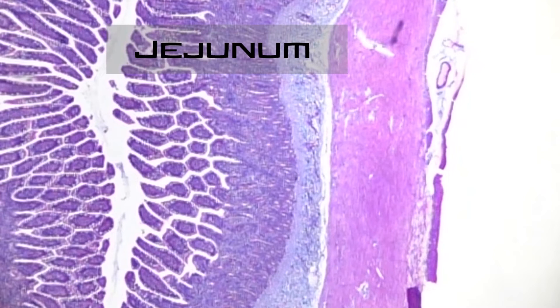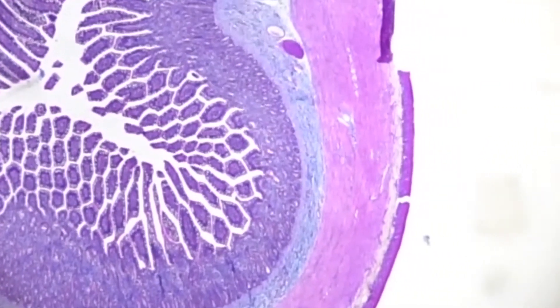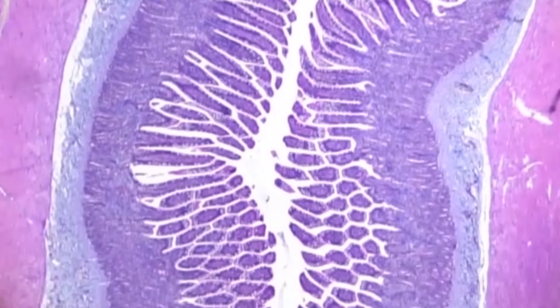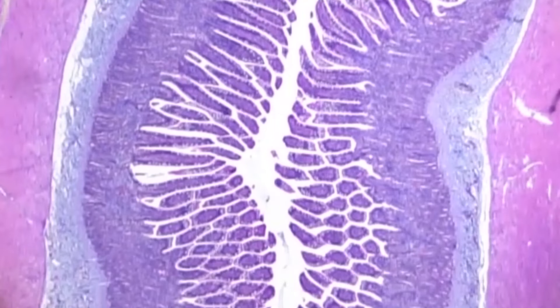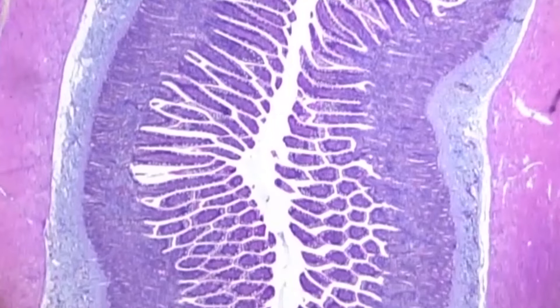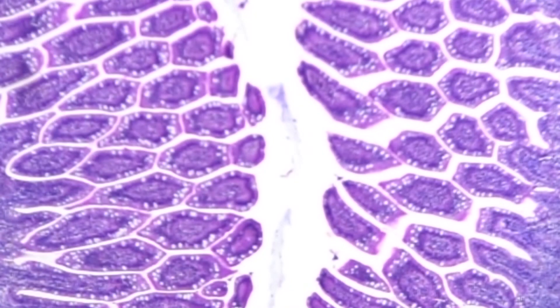The next slide is your jejunum, which is part of your small intestine. Your small intestine is a hollowed-out tube, so we're looking at a cross-section of a tube. In the center is what we call the lumen, where food passes through. The epithelial layer is here because you want to create a boundary between your food and the rest of the cells of your small intestine, and nutrients pass from the lumen into the cells. In the center of your jejunum are folds called villi, which increase the surface area. Even though they look like islands on the slide, they're actually connected folds — it just looks that way when the jejunum is cut and placed on a slide.